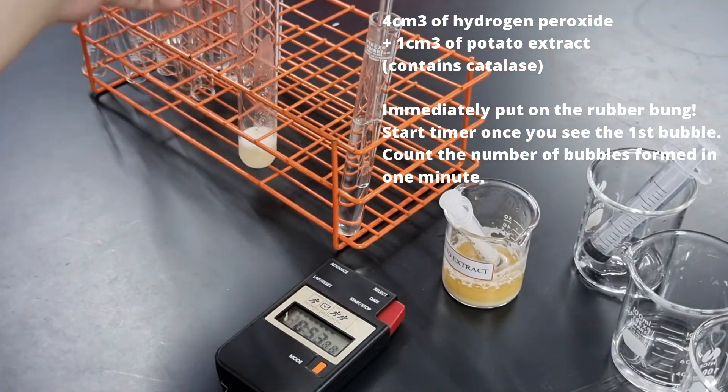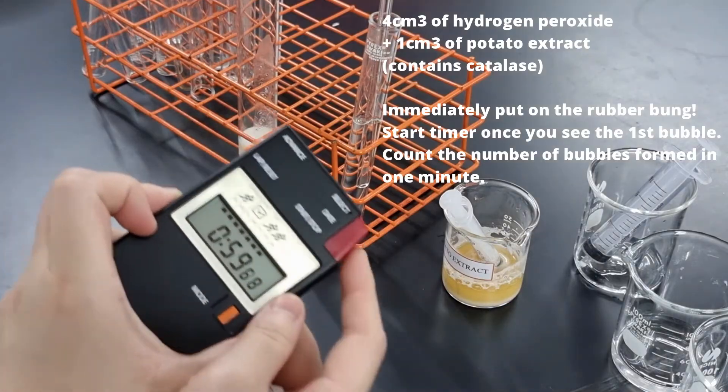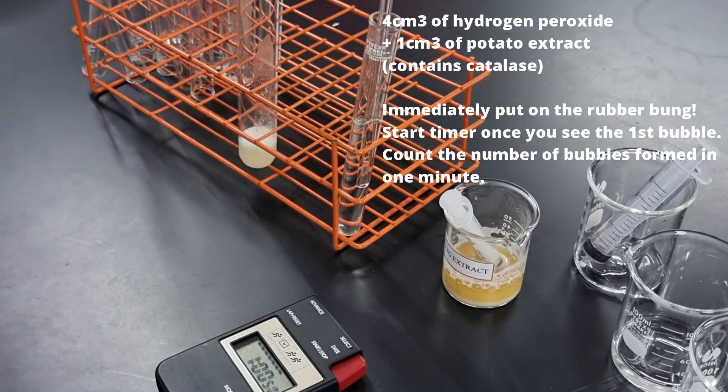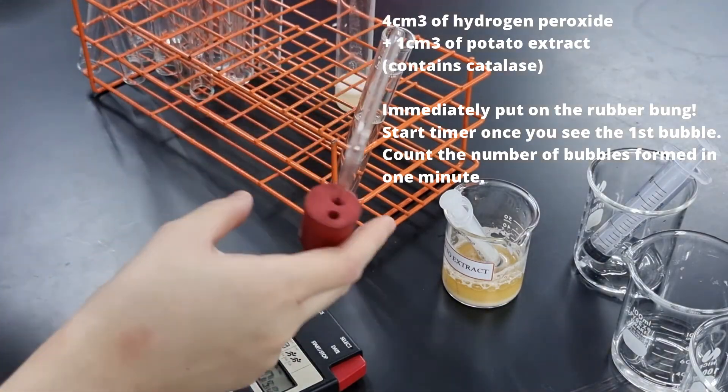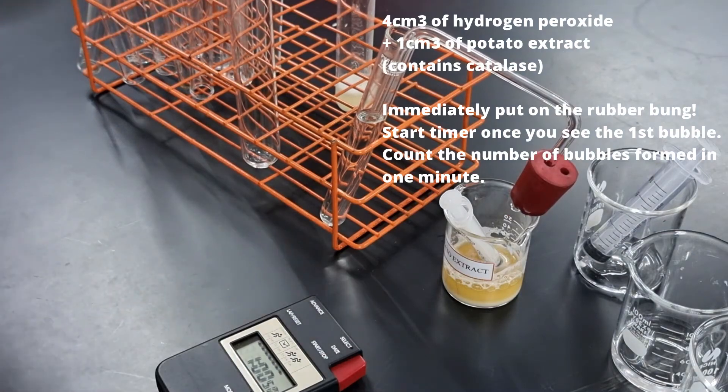Now the bubbles are not very obvious in this video, and will be shown in the next clip. But yes, after 1 minute, we stop counting the bubbles.